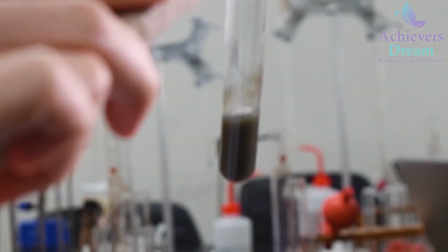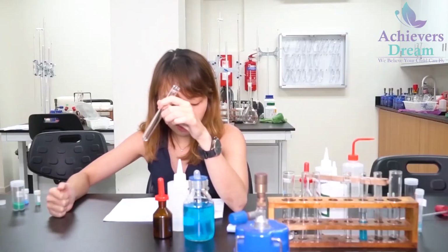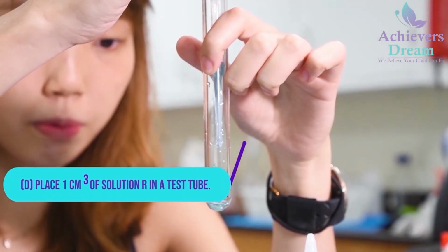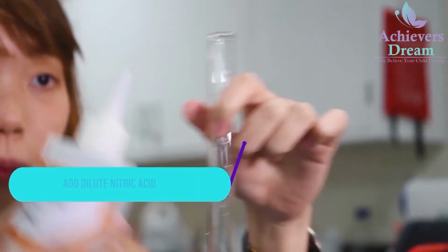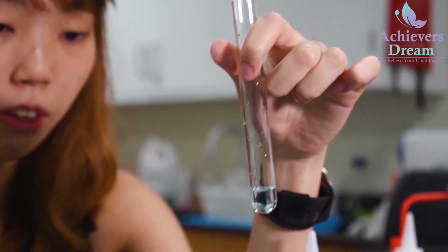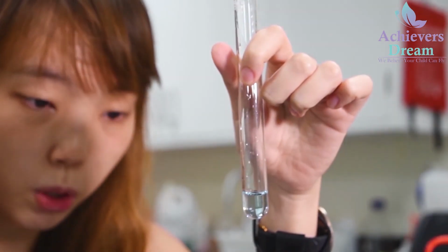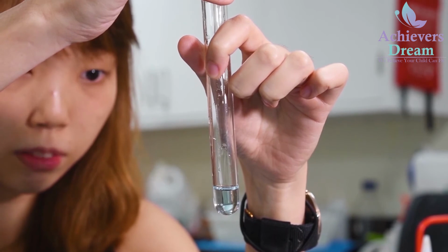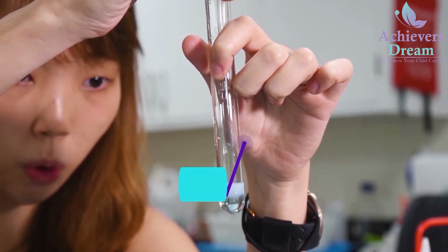You see that your blue precipitate has all turned to a black precipitate. For part D, I'm going to place 1 cm cube of solution R into your test tube, then add 1 cm cube of dilute nitric acid. When you add in dilute nitric acid, there's still no visible change. Followed by 1 cm cube of silver nitrate. Upon addition of silver nitrate, there is presence of white precipitate.